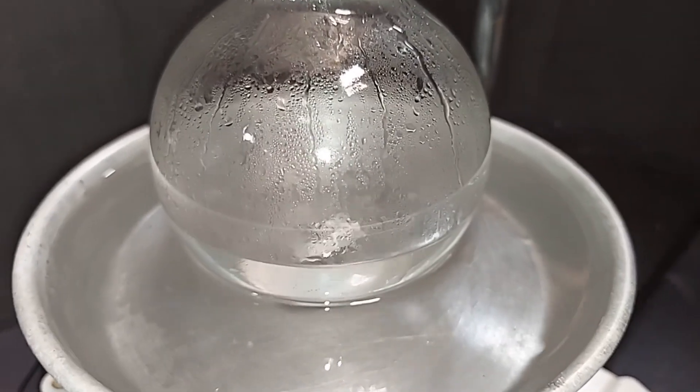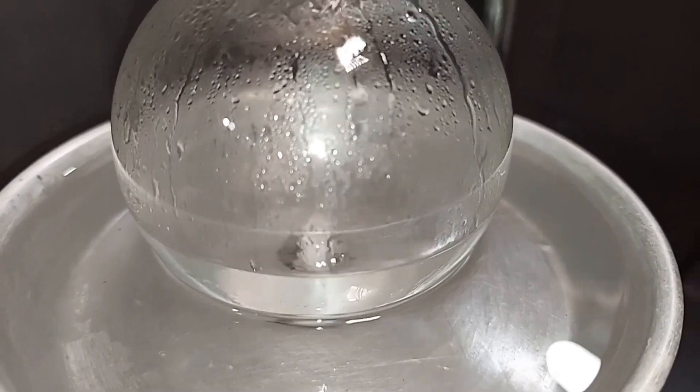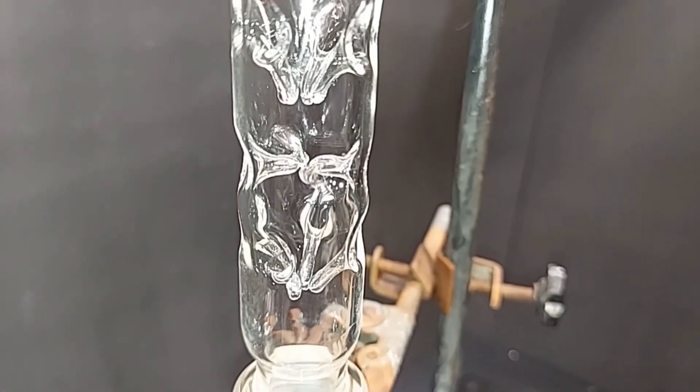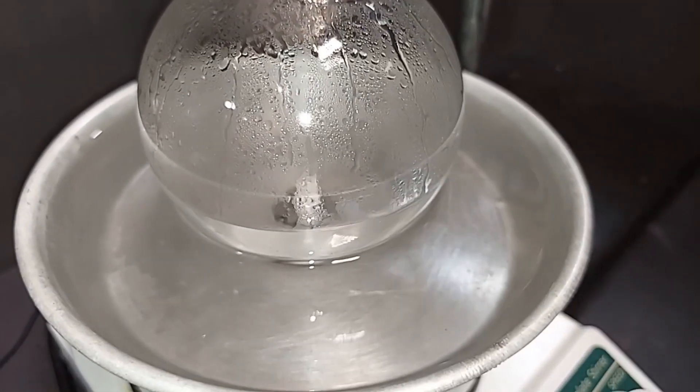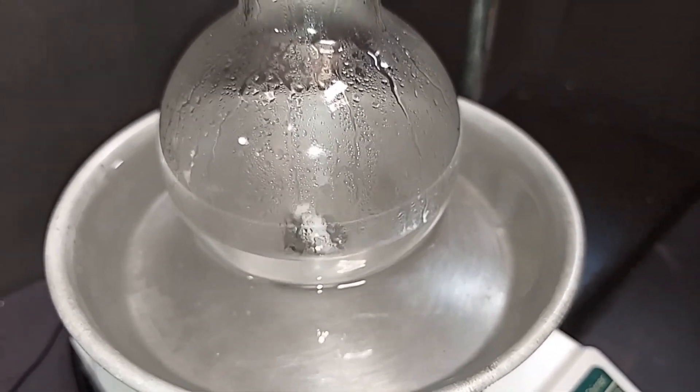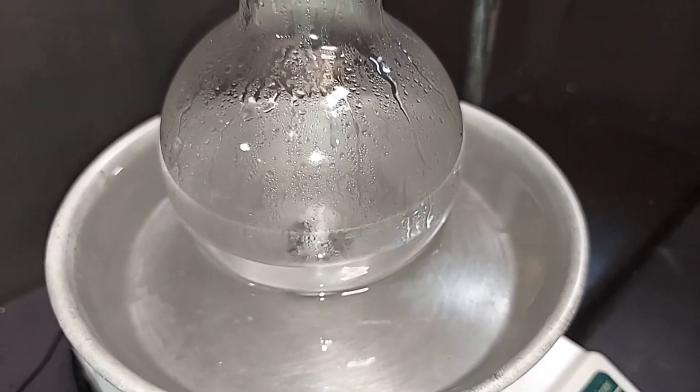It's been six or seven minutes since I last showed you this and it's boiling quite nicely. Plus we're seeing multiple levels with dripping. So the reflux is on real good. I just want to make a comment on the mineral oil. It is good up to 150 degrees Celsius, so we're well within its safe limits of use.